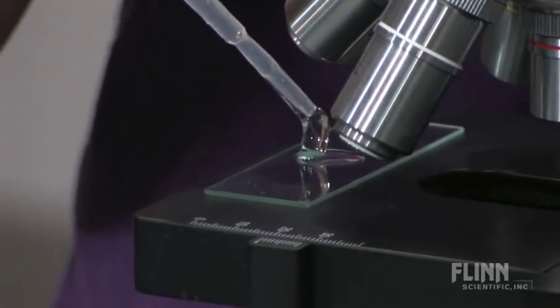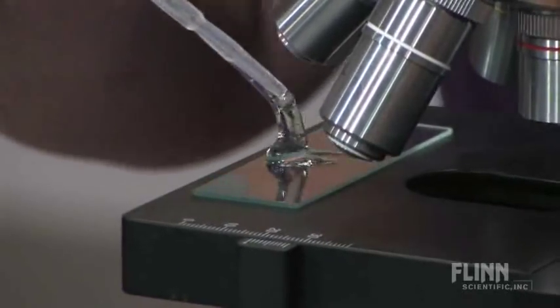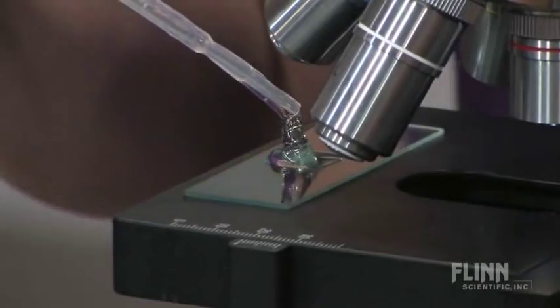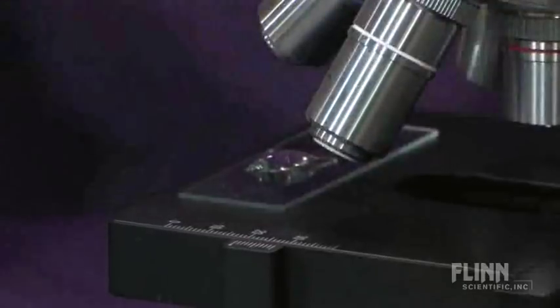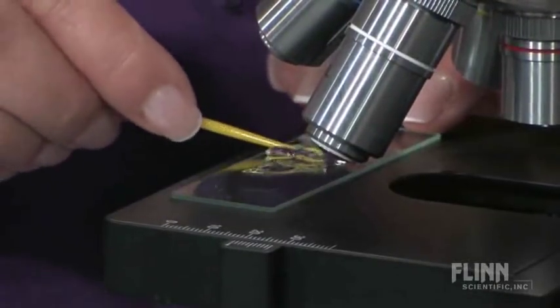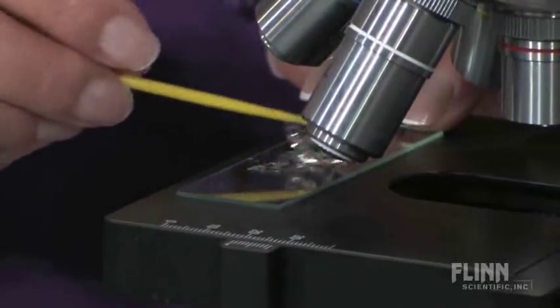Add one drop of methyl cellulose to the slide. This is very thick. And stir.